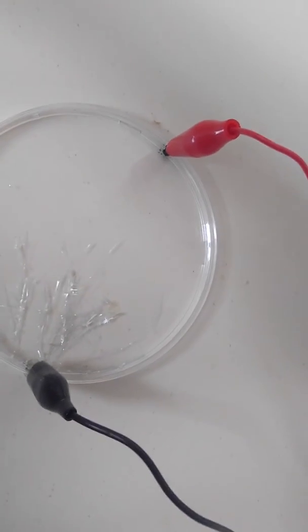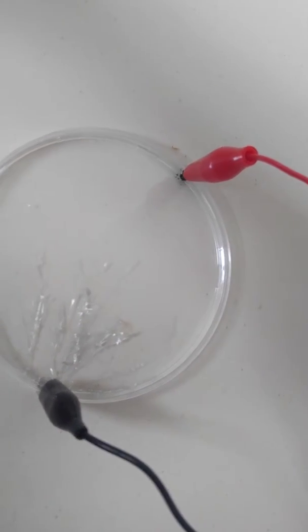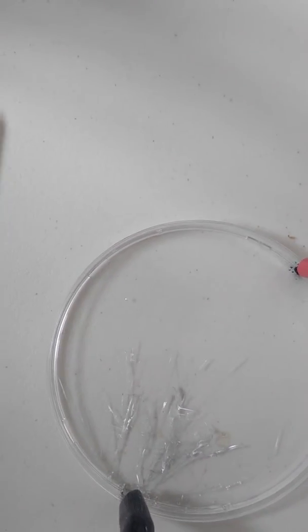That's so weird. It's growing metal. I didn't realize you could grow tin. Well, you're not really growing tin. The tin was already in there. You're just taking it out of solution.